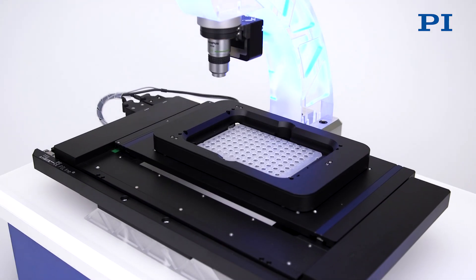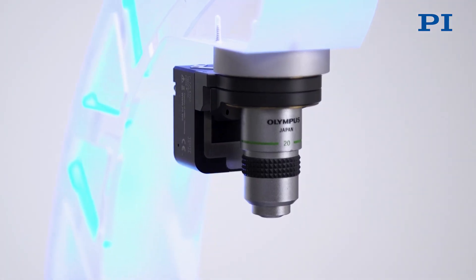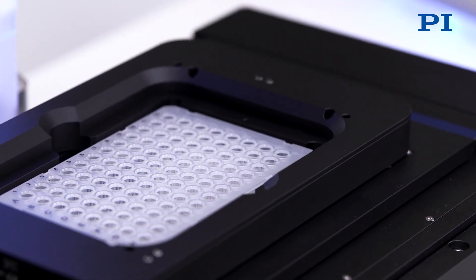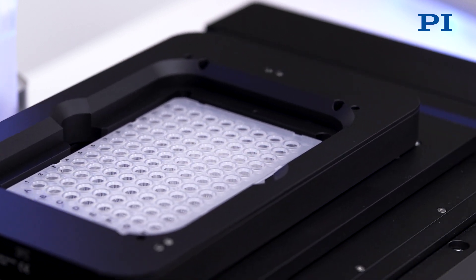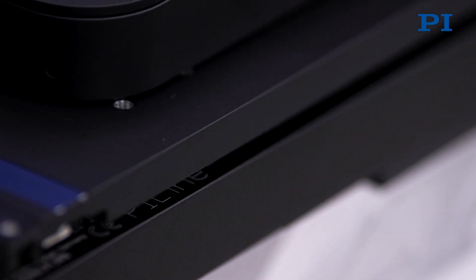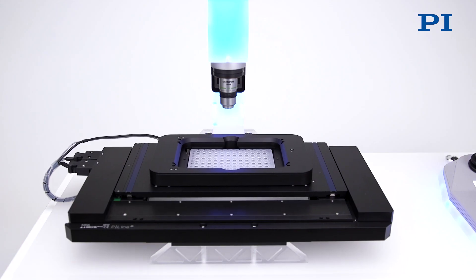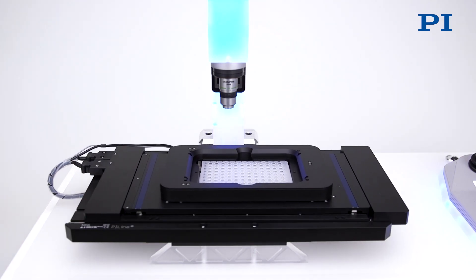In our display we see a PIFOC unit as a focus unit with nanometer resolution, a Z-Stage to move the sample for stacking applications also with nanometer resolution, and finally an XY-Stage with PI-Line motor driven for huge dynamic bandwidths — so it can run at micrometers per second as well as 100 millimeters per second.